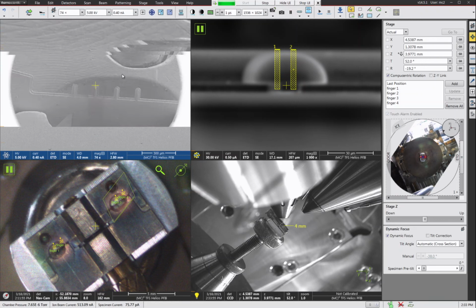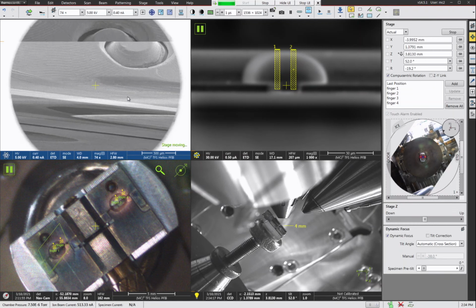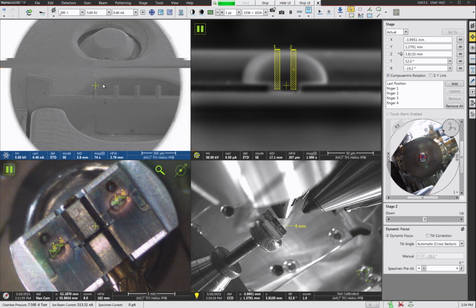Now in the SEM, this isn't so hard because you can see the reference number in the grid, this four that's down here. But you won't be able to see this in the atom probe. You might be able to see that in the TEM as well, but keep in mind that the atom probe holders generally obscure that. So you need to make some kind of mark up here on the top so that you'll be able to see it. All right, so let's go back to finger number one, because this is just a demonstration.